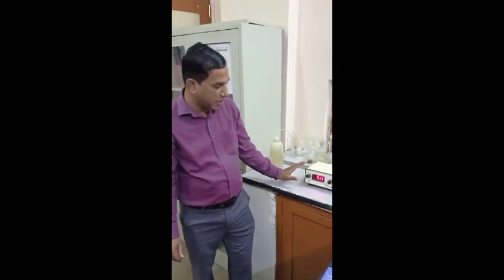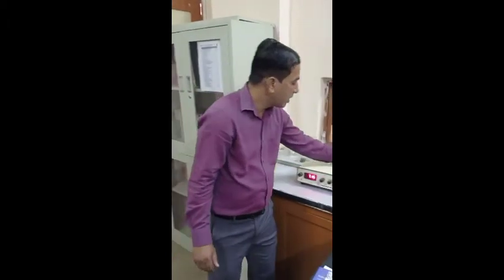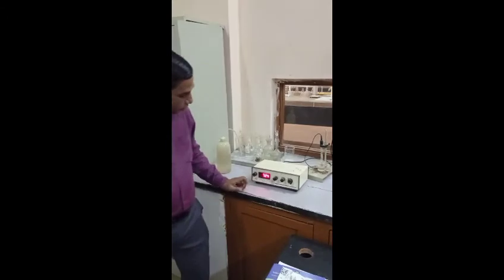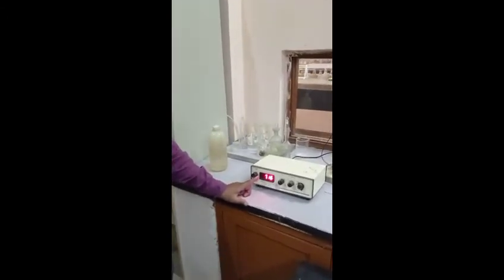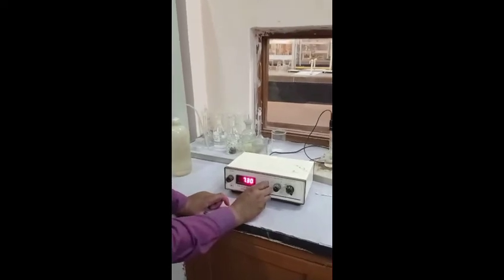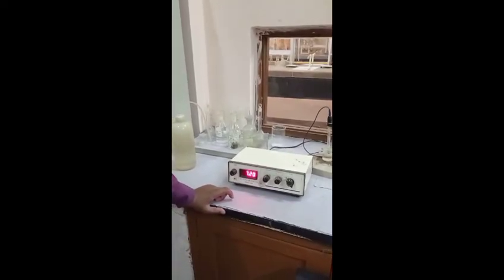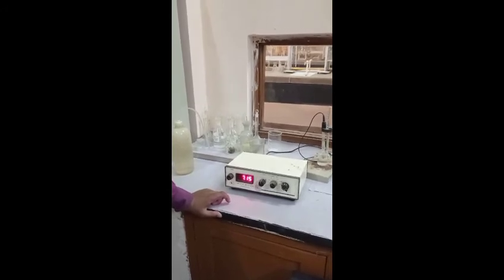The last parameter is pH. We use a calibrated pH meter. We take a water sample, dip the glass electrode into the water sample, and from the display we can read the pH of the water sample. After setting the temperature, the pH is around 7.2.